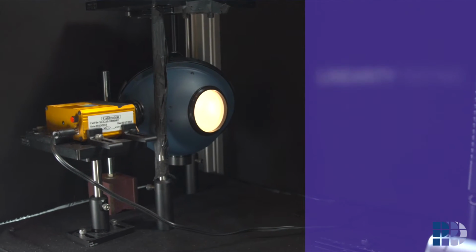I'm in the optics lab and I have with me the camera after initialization. So after checking the sensor and making sure it is clean, I'll be starting with the linearity test. So what is linearity? We know that the fundamental process of a camera is to convert incident photons of light into electrical signals. So the linearity test is conducted to test and verify the camera's response to the incident photons. So whether it is linear, and if so, what is the slope of this line? So how do we do it? Let's take a look at the setup.